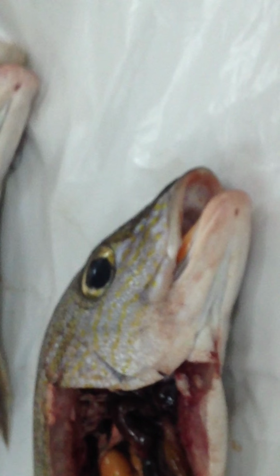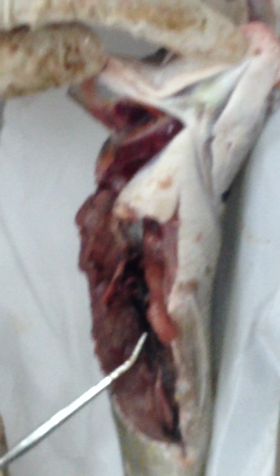So these are most of the organs in the abdominal cavity or body cavity of the fish. We should not really call it abdominal cavity or even thoraco-abdominal cavity, because those are terms for higher vertebrates; in fish the body cavities are not very distinct. So we just call it coelom. Okay, so these are most of the organs in the coelom.